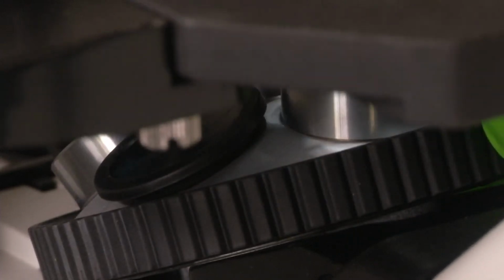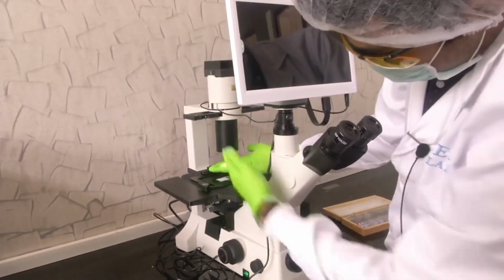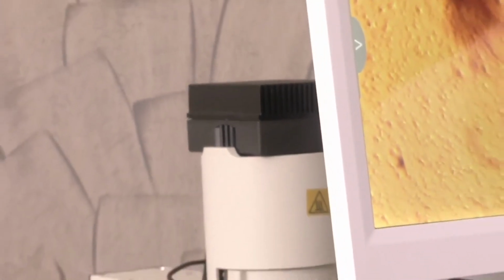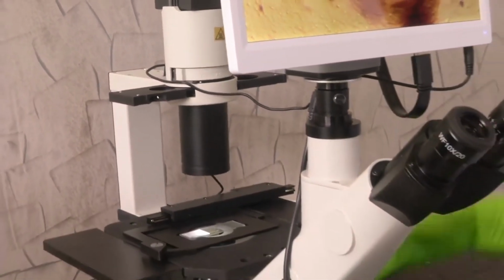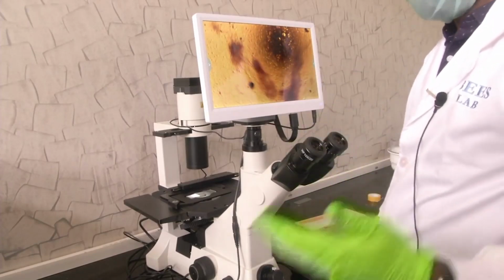So, if you notice, this is the main difference. In the previous microscopes which we saw, the turret was here on top. But now here what do we have? We have the light source. See, the light source is coming from the top. This black color box here is the arrangement that generates the light source. In the previous designs, we had the light source from the bottom, and in the metallurgical microscope which we saw, there was a light source from top and from bottom, but in all the microscopes, the turret was on top. Here we have the turret below. This is the core difference of the inverted microscope when compared to any other microscope.